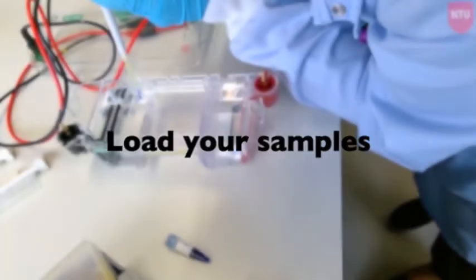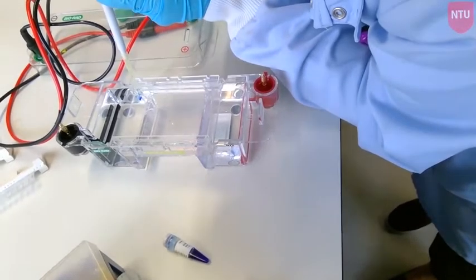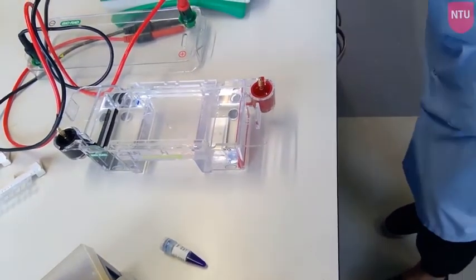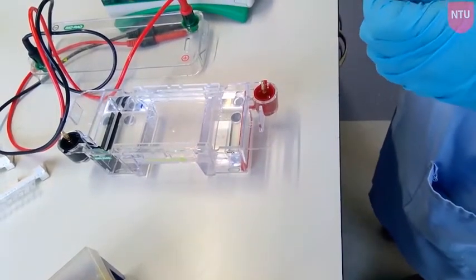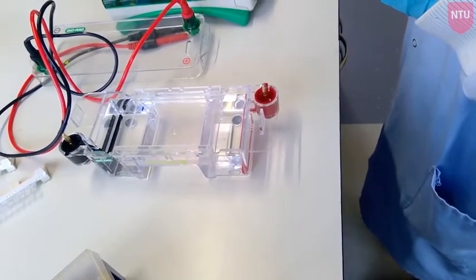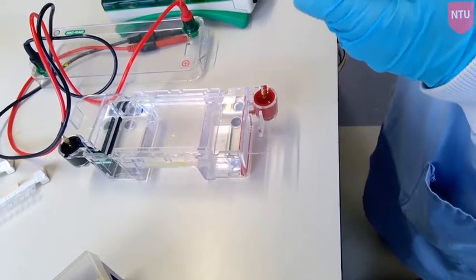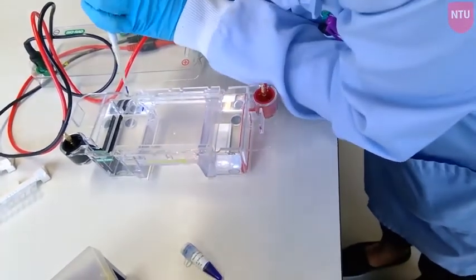Next, add your samples to the wells in the agarose gel. Carefully pipette the samples by hovering your tip at the top of the well and gently depressing the pipette. Try not to touch the agarose gel with your tip as you may break it. If you have shaky hands, it is often helpful to use your other hand to steady your pipetting hand.